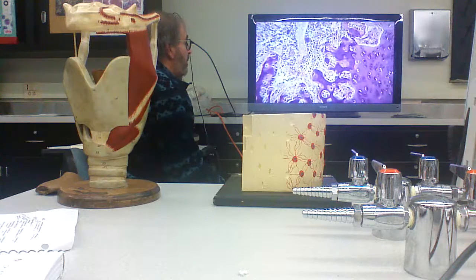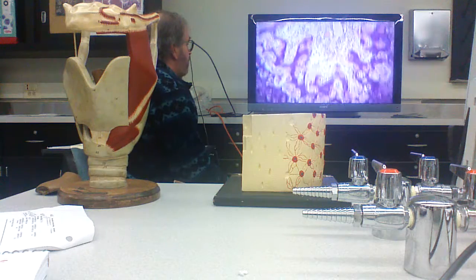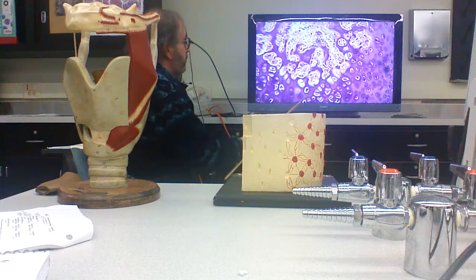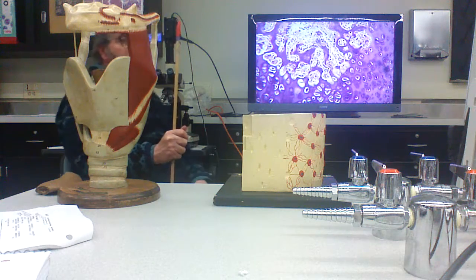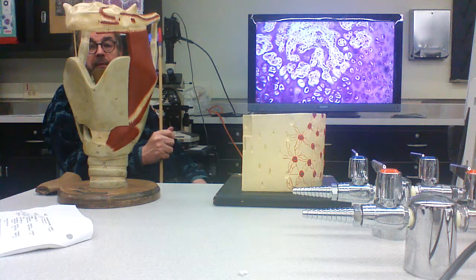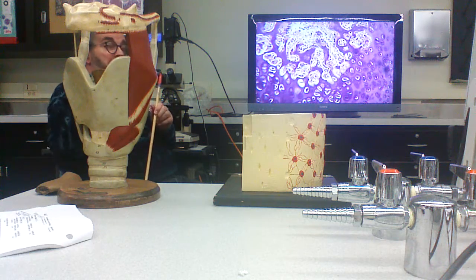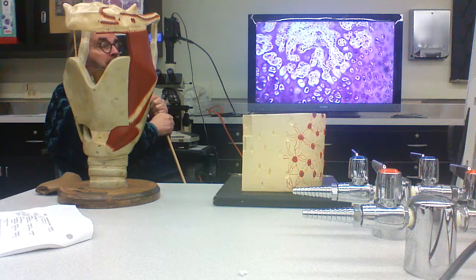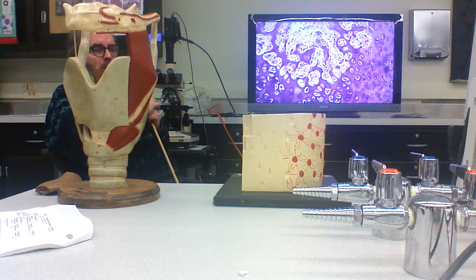Down below, you should have areas of erosion, and that's where you're likely to find osteoclasts. Here's one. The thing about osteoclasts is they come from the monocyte macrophage cell lines in the bone marrow. So they're actually phagocytic cells. And before they form functional osteoclasts, they fuse. And so osteoclasts are going to be big cells. They're going to have multiple nuclei, maybe as many as 30 or more.